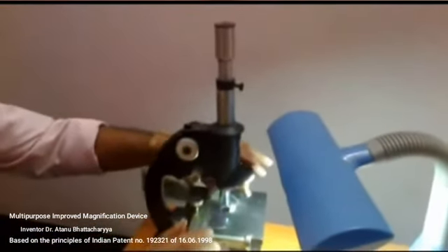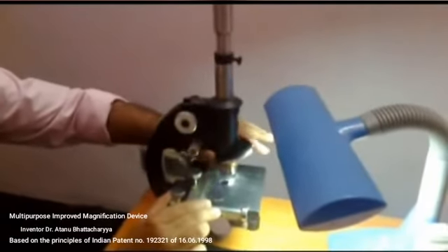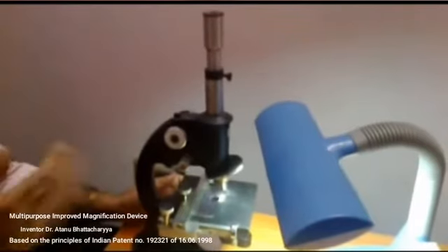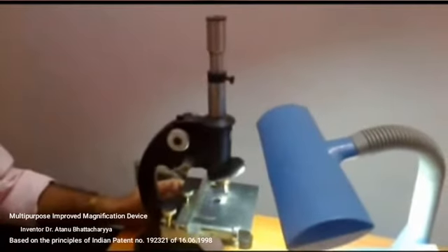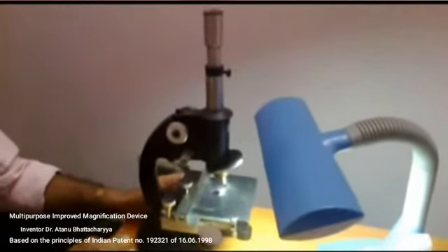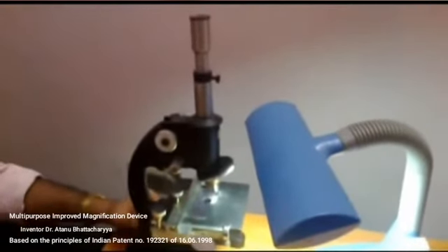By using 10x objectives or 4x objectives, 30 times magnification can be achieved by this device. So by this device, the dissection can also be done. Actually, different magnifications can be achieved through a single objective. So by the different objectives, all the intermediate magnifications can be achieved, which can be used in the pathological laboratories. And for dissection also, we can achieve 30 to 150 times magnification. By this 4x objective, we can achieve 70 times magnification very clearly. Then if we use 10x objective, then up to 150 times magnification can be seen very clearly for dissection purpose.